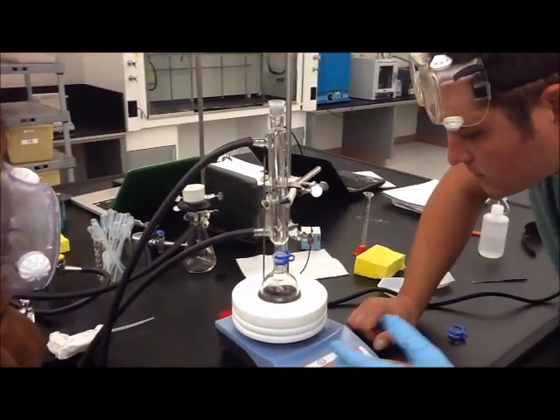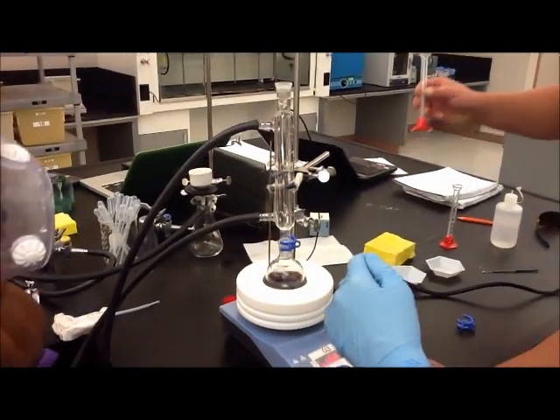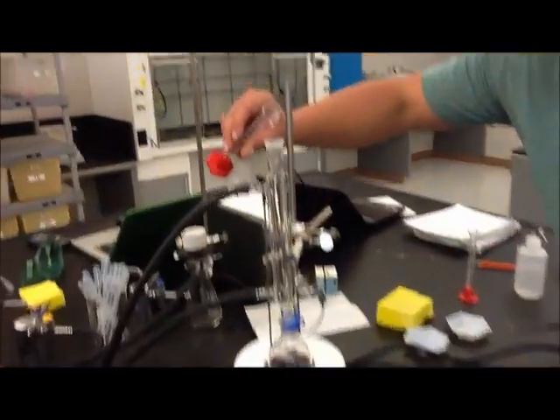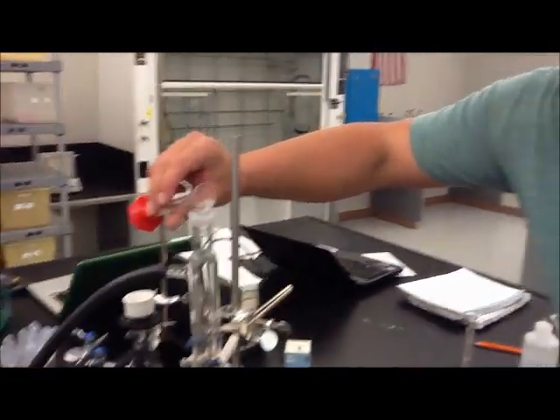Yeah, that looks completely dissolved. Now let's add the bromoethane. Who's timing? What's the clock read? 8:22.